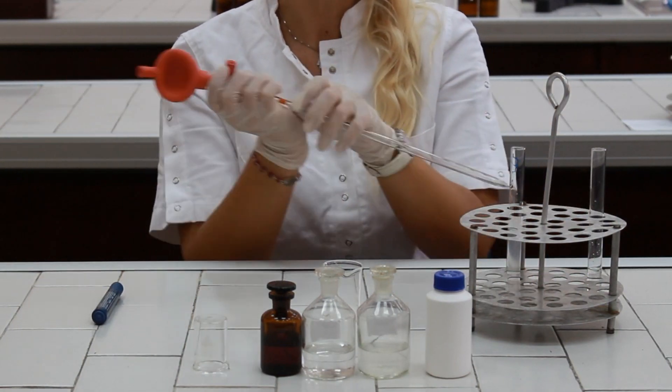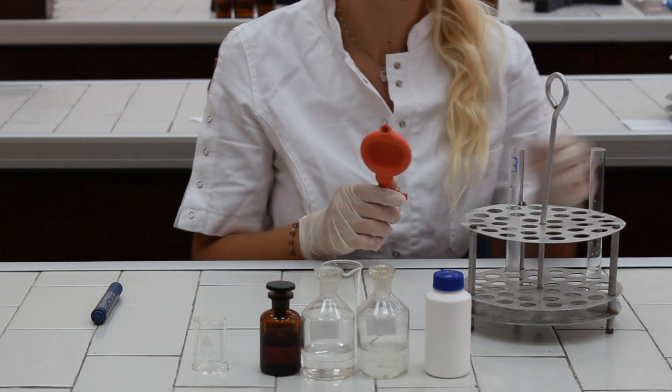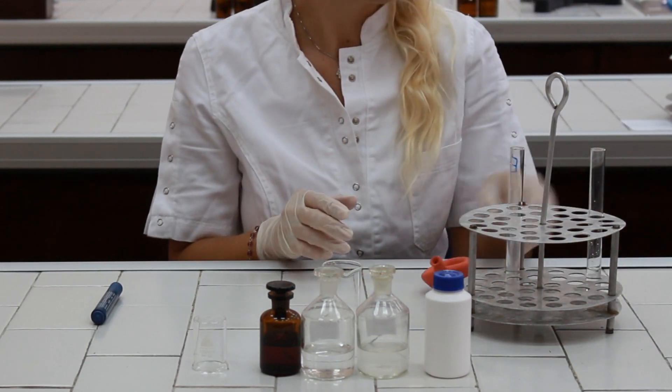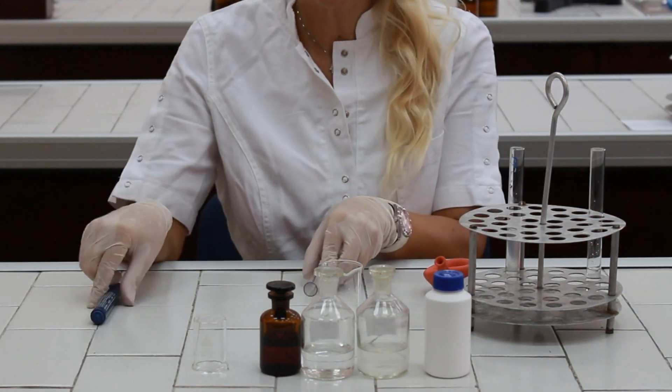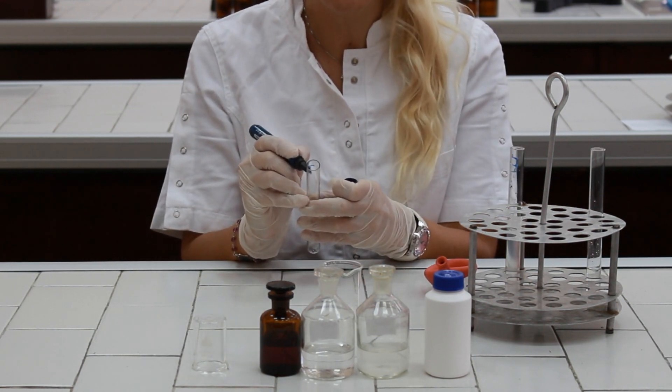After preparation of an enzyme, we have to proceed and prepare the optimum condition for the enzyme activity. For that purpose, we are going to take one test tube and mark it with, for example, T as test.